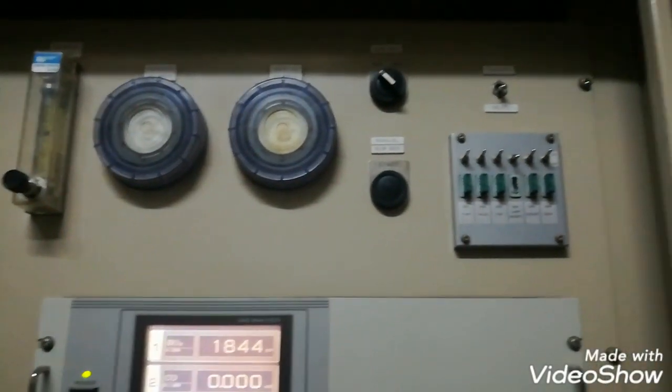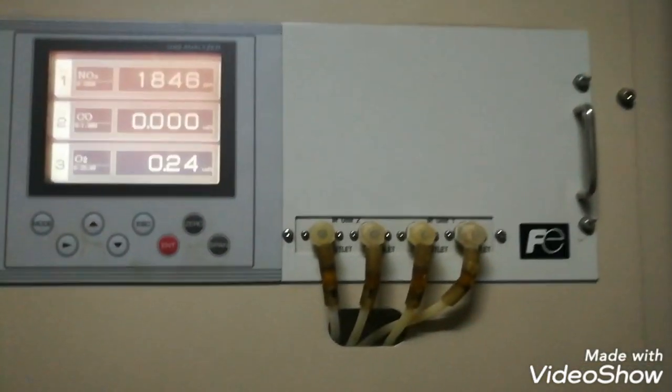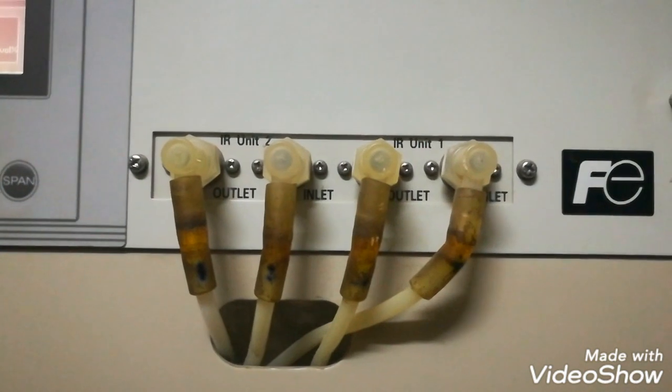In this video we will see our NO2 to NO converter in a gas analyzer. As you can see the analyzer, this is the input and outlet tubing, and this is the NO2 to NO converter. This is the FUJIGAS infrared gas analyzer.